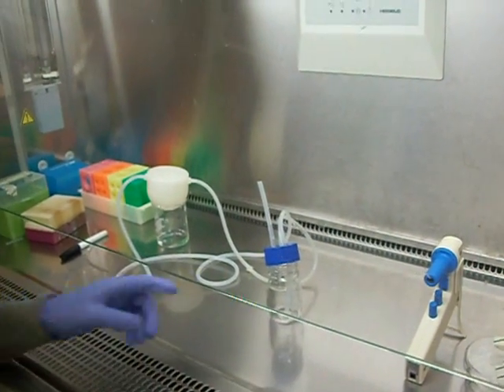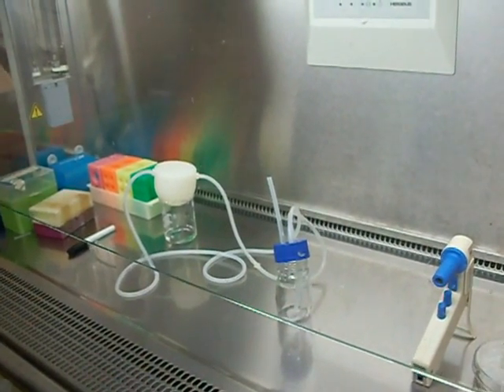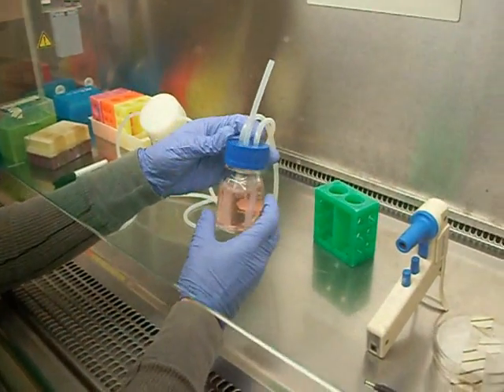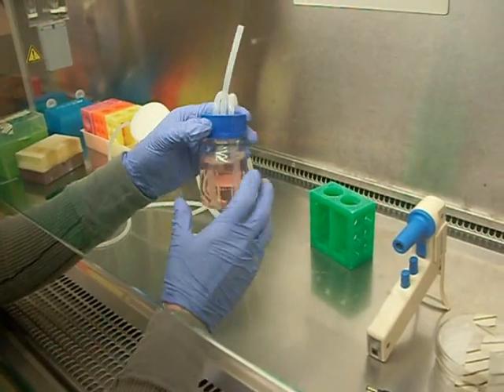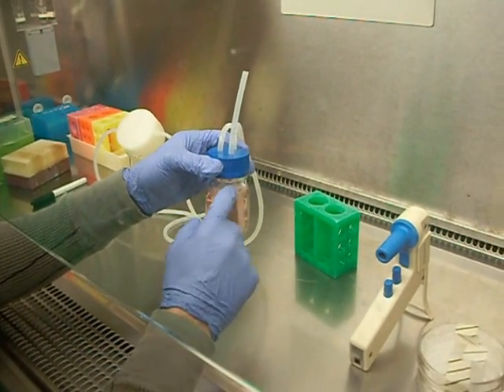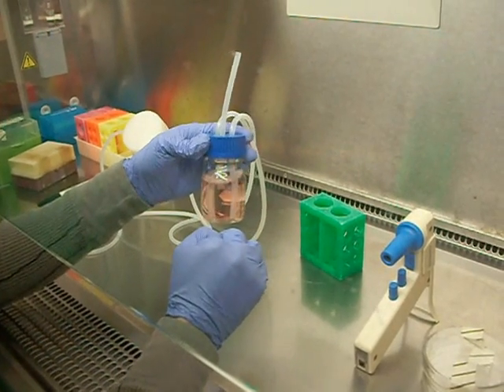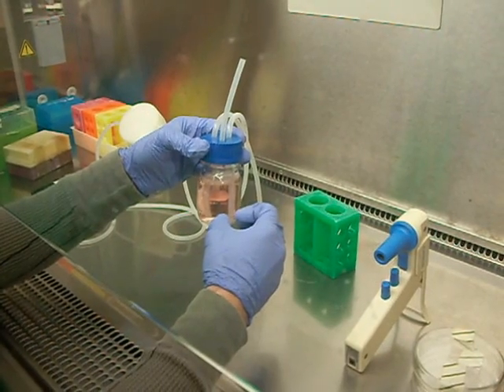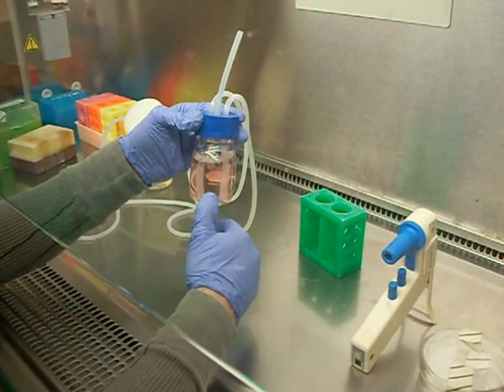We'll go get the media now to put into the reservoir. So we have the media in the reservoir now, and we want to make sure that our tubing is well in the media so that it can pump the media out without just sucking out air. And we have an extra tubing here so that we can take samples from the reservoir for nitric oxide analysis.